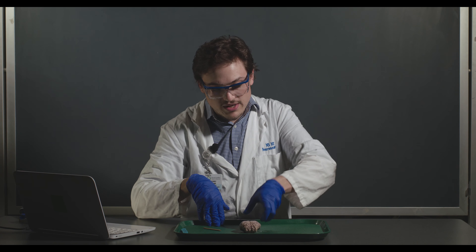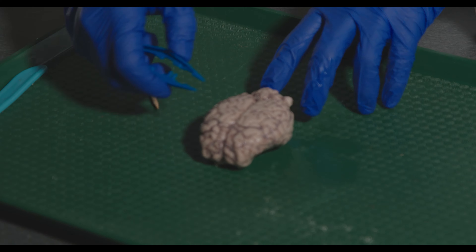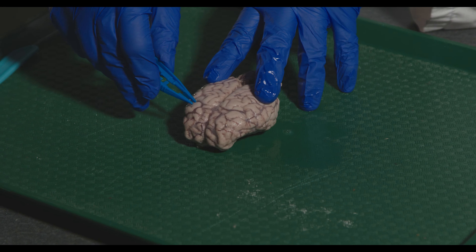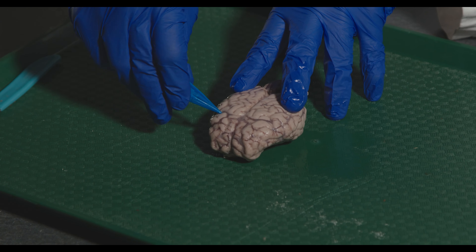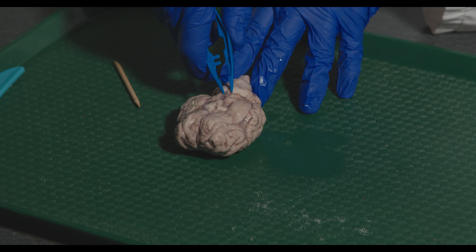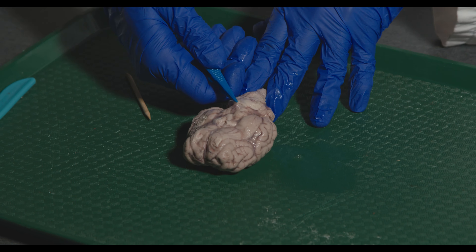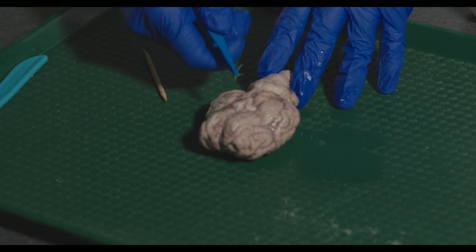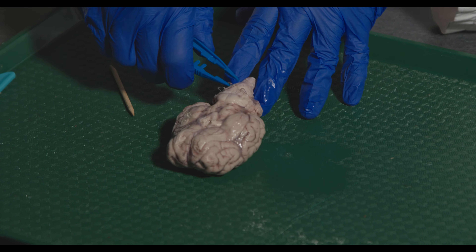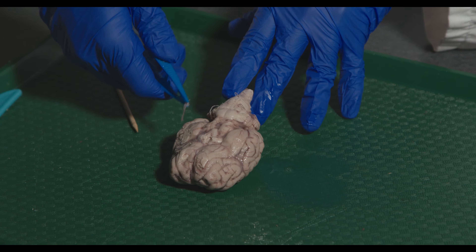The pia mater hugs the brain really closely. You can tell the arachnoid mater is still present because you can see blood vessels — blood vessels run between the arachnoid and pia mater. If you peel some of it back from the ventral side, you can see the web-like, spider web material — that is arachnoid mater. It gets its name because it looks like spider webs.